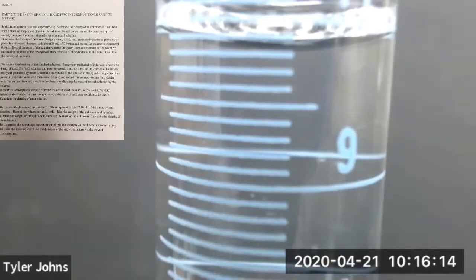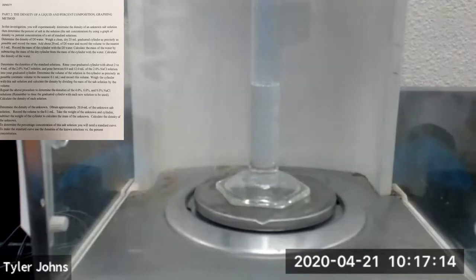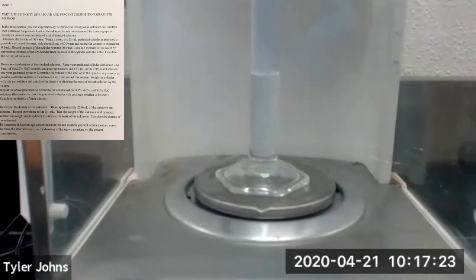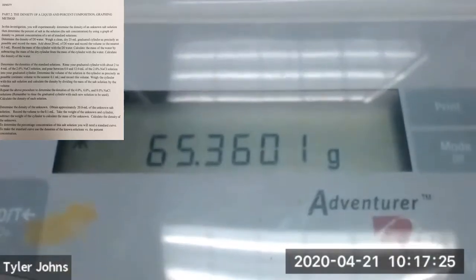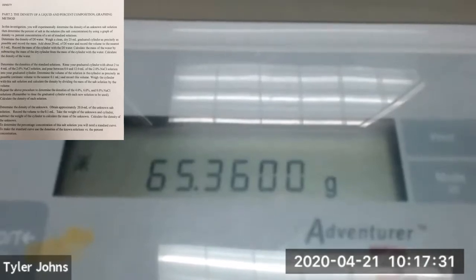We're now going to determine the mass of the graduated cylinder plus this volume of 6% sodium chloride standard. Okay, so the mass of our 25 mL graduated cylinder plus the volume of 6% standard salt solution that we added is 65.3601 grams.